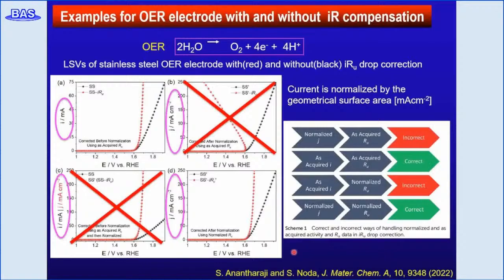If IR drop correction is done using as-acquired current and as-acquired Ru value, normalization can be done for IR drop correction without any errors. Therefore, we should know whether the current and compensated resistance Ru are normalized by the geometrical area of the electrode. And this is a scheme to obtain the correct data. And these B and C are a bad data set.